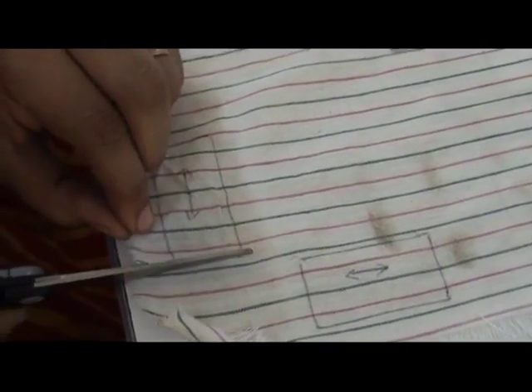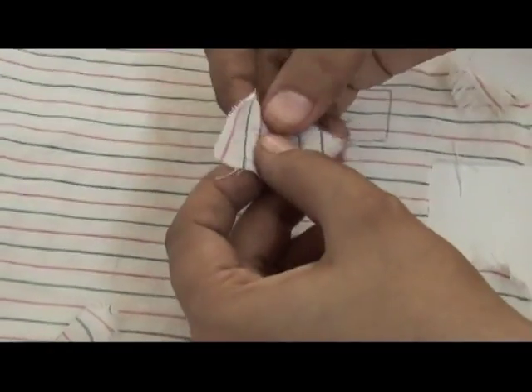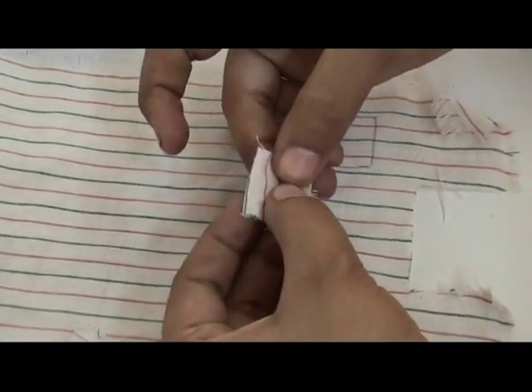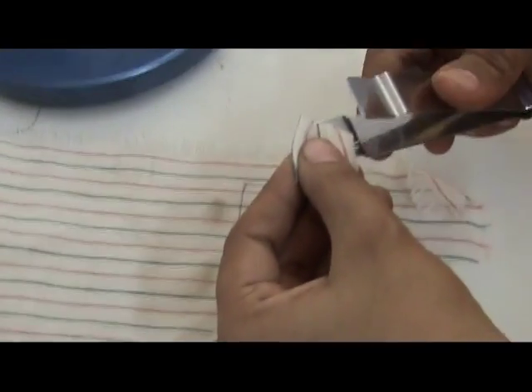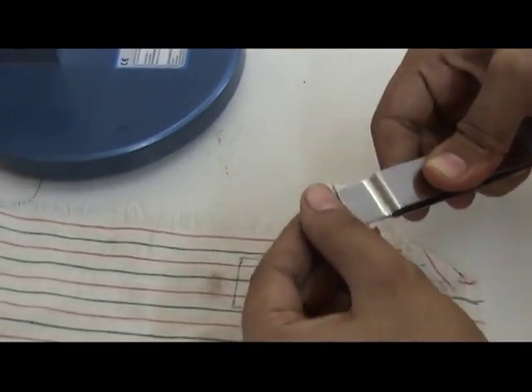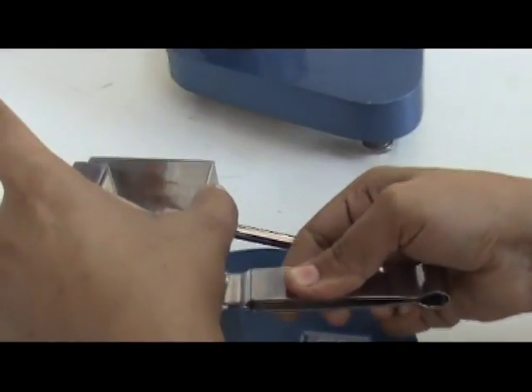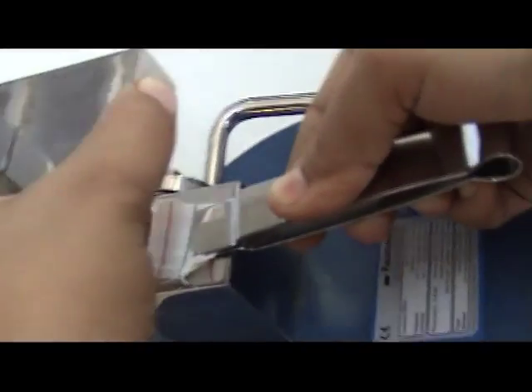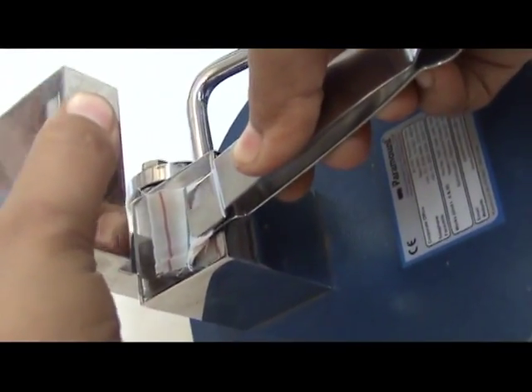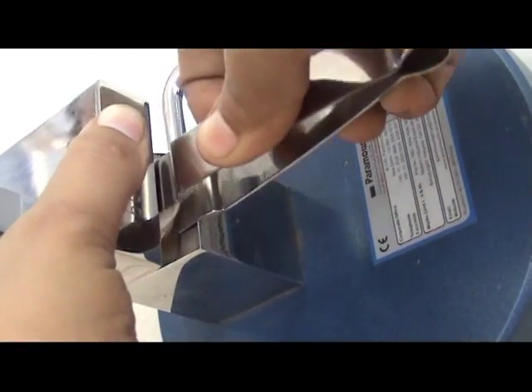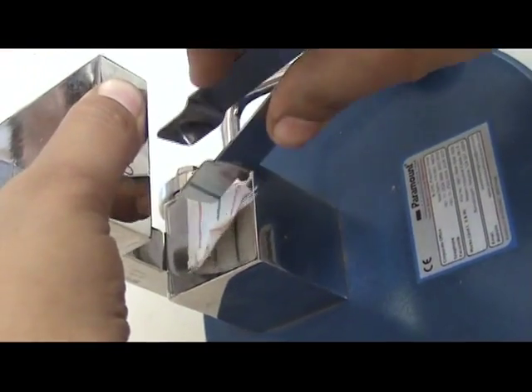With the help of tweezers, half of the test specimens in both cases are folded face to face and the other half back to back. The folded specimens are placed on the loading device and allowed to develop the crease.